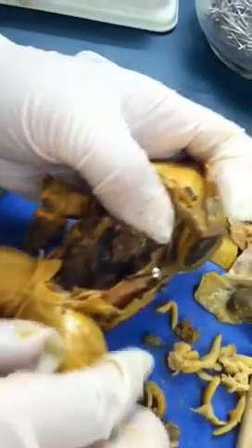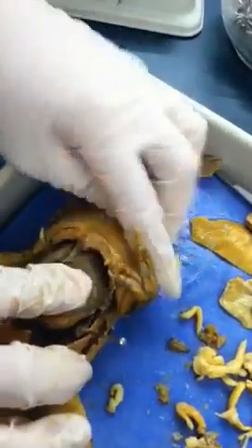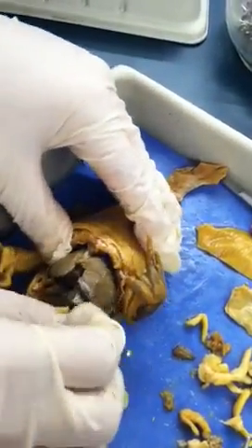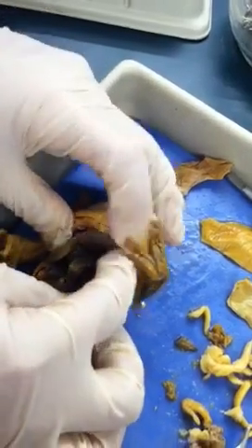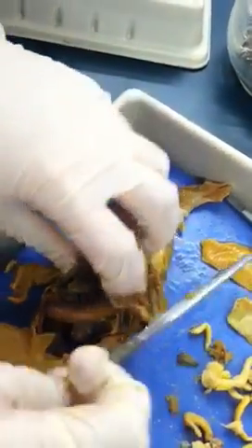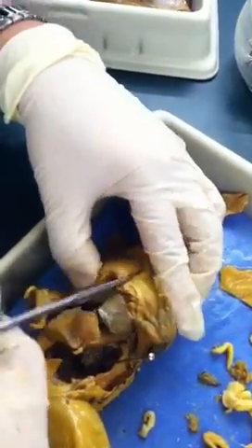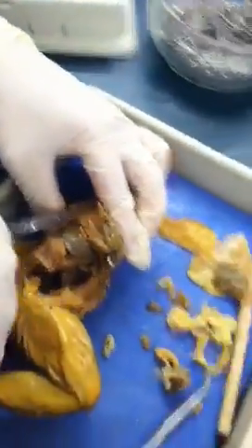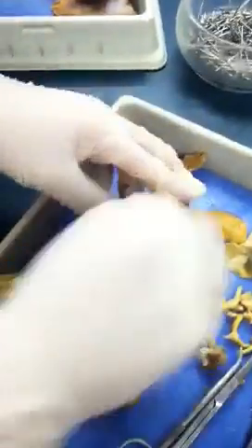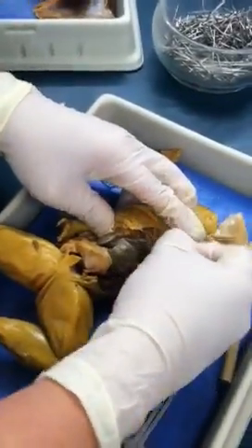Later I'll give you an overview to show you better. Now let's get to the upper parts. If I remove the liver and cut it open — I'm actually ripping off the ribs so I can show you the chest region.